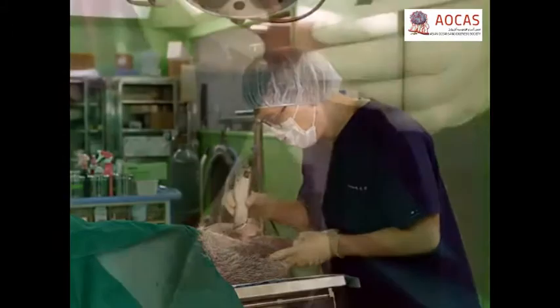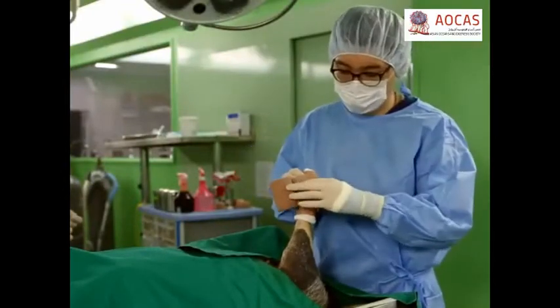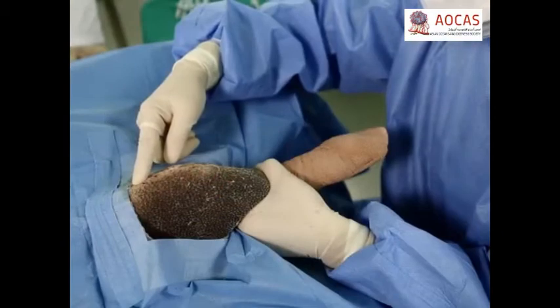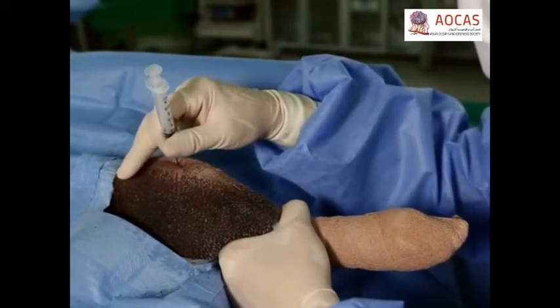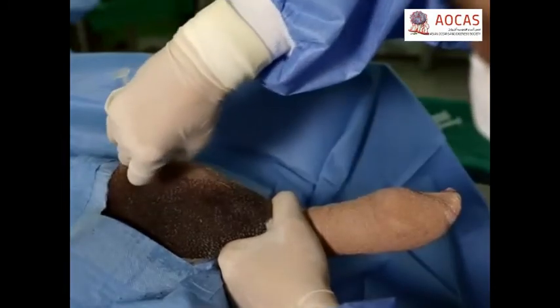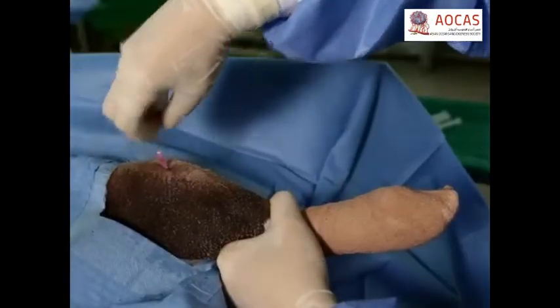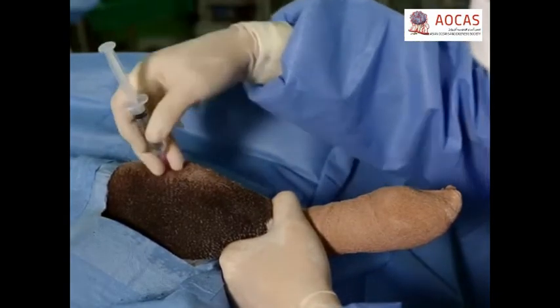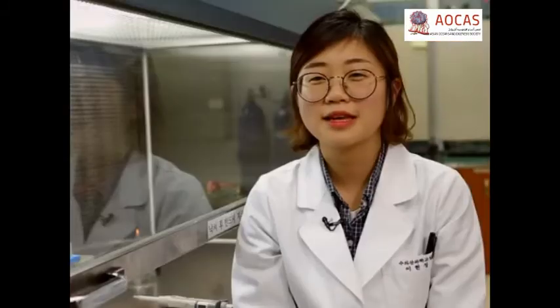Prepare a 15 by 10 centimeter section of skin over the femoral joint as was done when preparing for bone marrow collection. Then, palpate for the patella and tibial crest below the skin to identify the synovial joint and insert a 3-milliliter syringe with a 23-gauge needle precisely into the joint. Using gentle suction, extract between 0.5 and 1 milliliter of fluid and immediately withdraw the needle. If the synovial fluid volume is too small, flush the cavity with DPBS to collect synovial fluid with DPBS. The volume of DPBS to use varies with the size of the synovial cavity. Note that the obtainable volume of synovial fluid is limited in healthy joints and varies with the size and pathological condition of each joint.